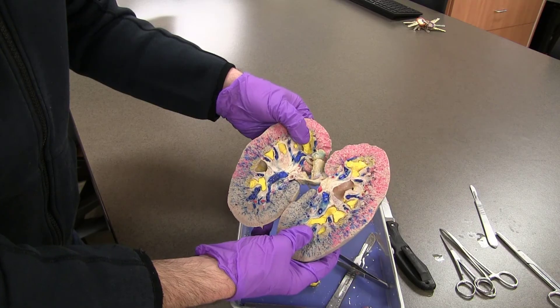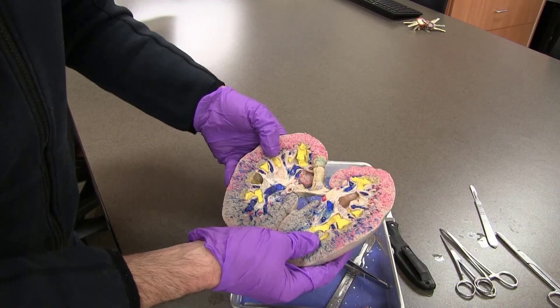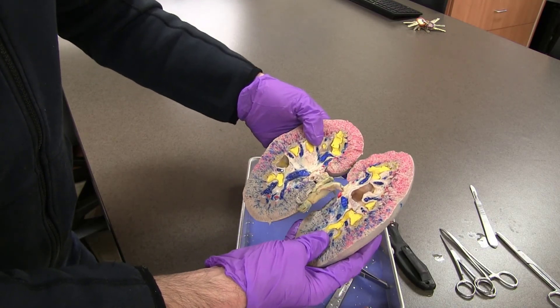I'm glad we had a pretty good one today, to be able to see the actual areas where we expect to see the different fluids — oxygenated blood, deoxygenated blood, and urine in the kidney.